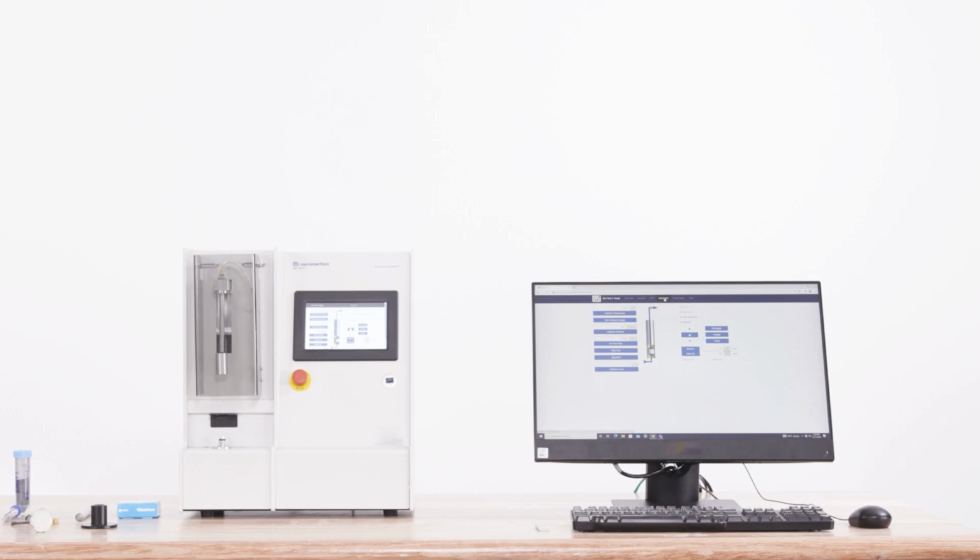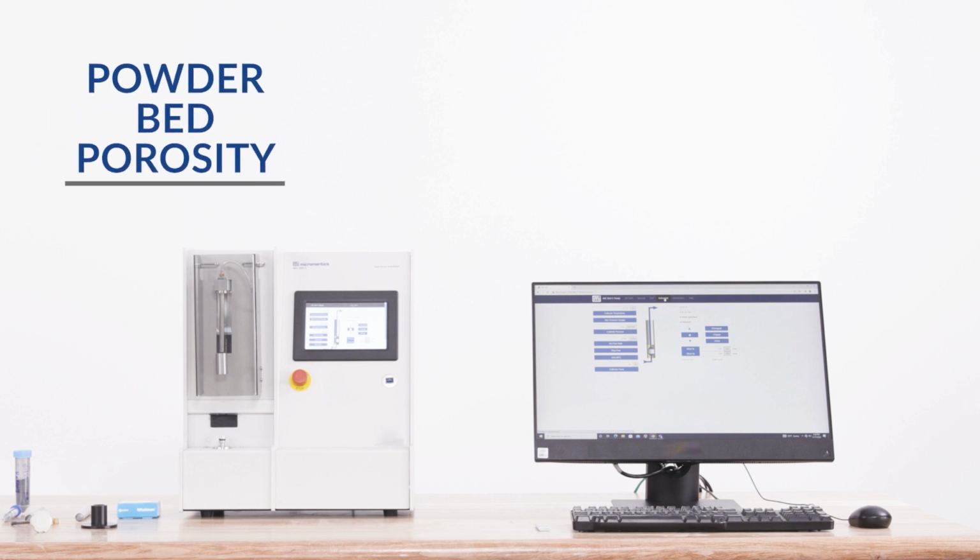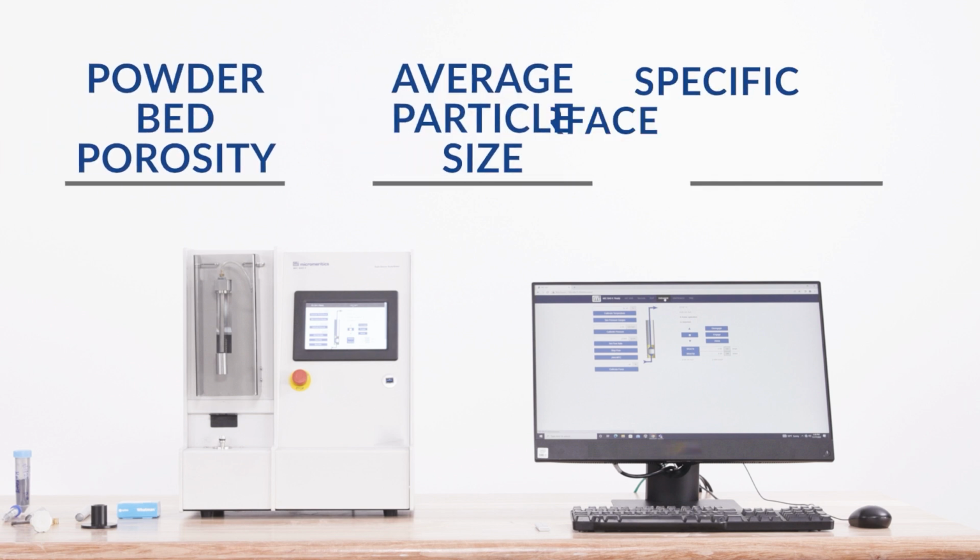Today we're going to be looking at the Micromeritics Sub-Sieve AutoSizer 2, or SAS 2, for the determination of accurate and reliable particle size data. The SAS 2 is a fully automated version of the Fisher Sub-Sieve Sizer and determines powder bed porosity, average particle size, and specific surface area.